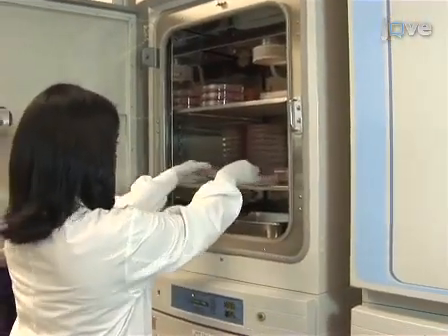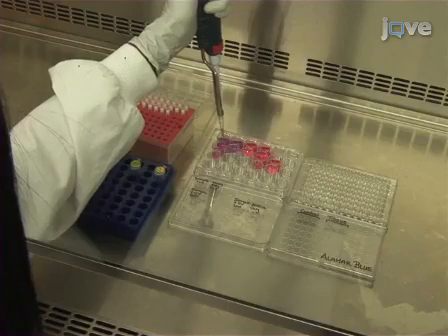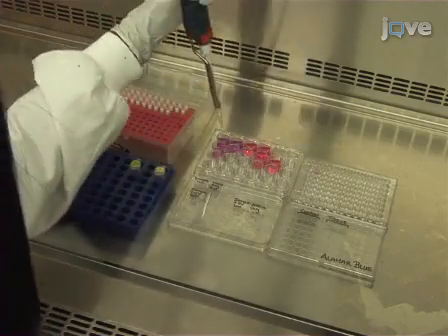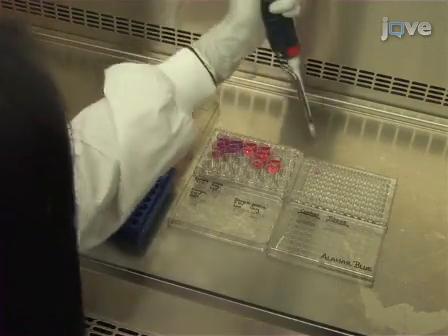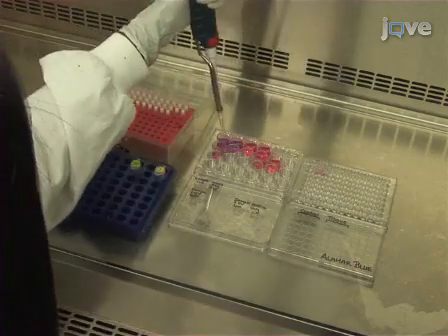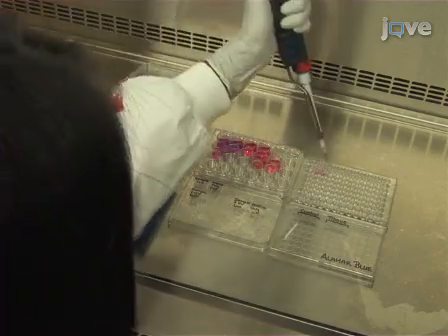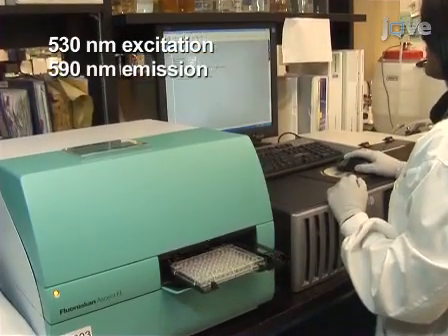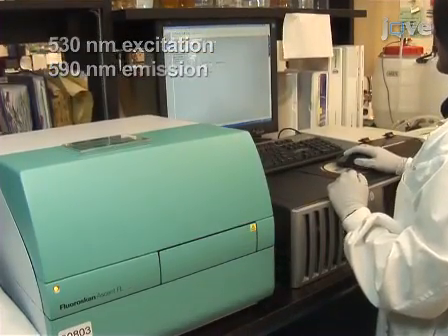After the incubation time has elapsed, remove 3 100 microliter aliquots from each Alamar Blue treated well and deposit them in separate wells of a 96-well plate. Repeat with 2 further 100 microliter aliquots from the same wells. Read the Alamar Blue signal using a fluorescent plate reader and record the data.